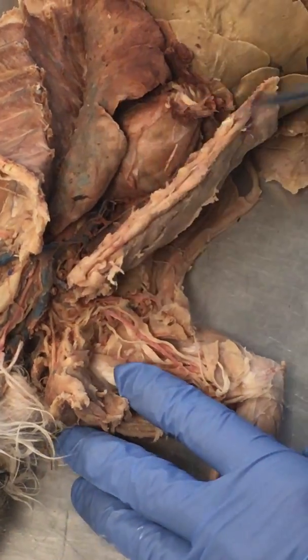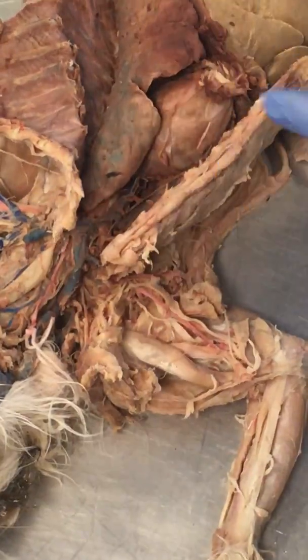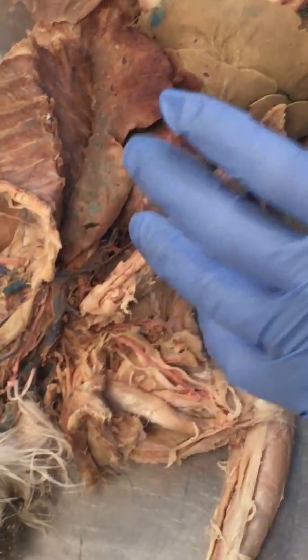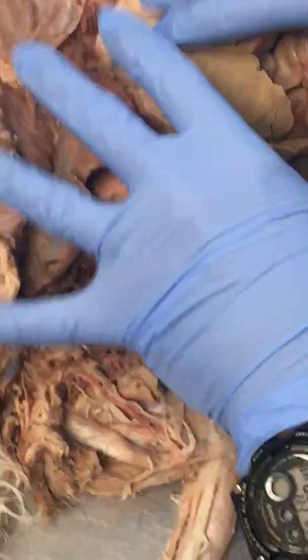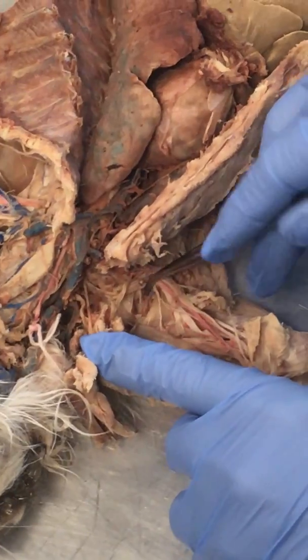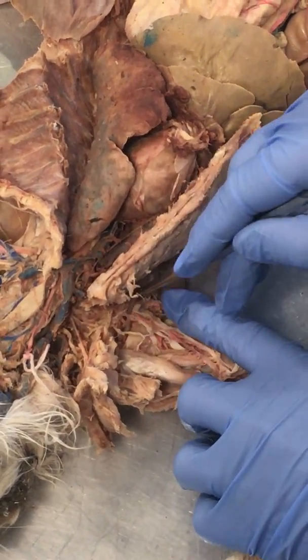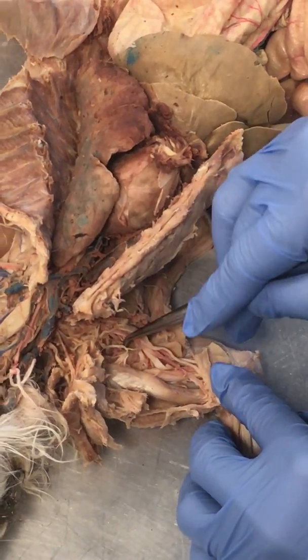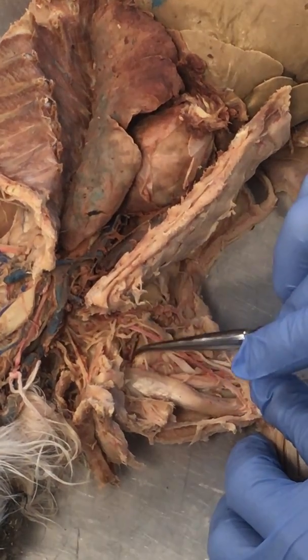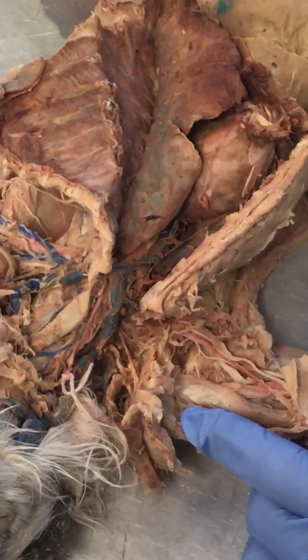We might ask that on a picture, but not on the cat. I try to be relatively fair when it comes to the cat. The vessels are relatively large and easily identifiable, then I would say that they're fair game on this, but some of these aren't, because unless you do a lot of this, it's hard to find where they're actually traveling. But right there, going back in that space, underneath latissimus dorsi, back in that region is subscapular. And those usually will be an artery and vein.